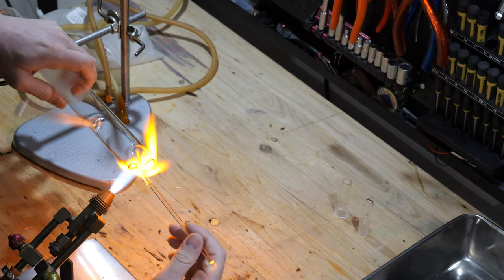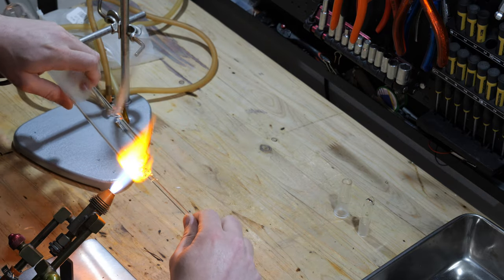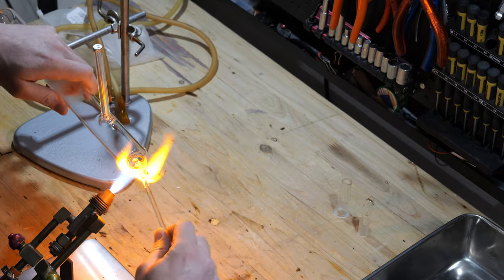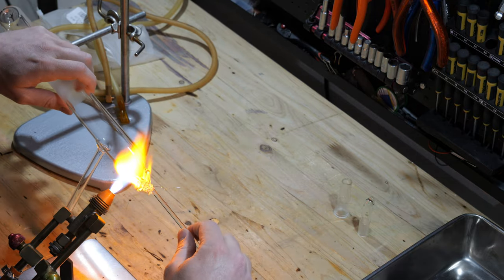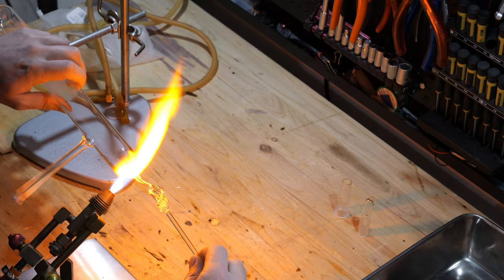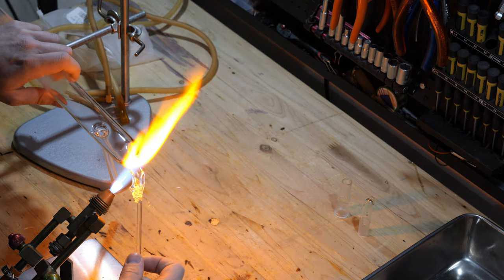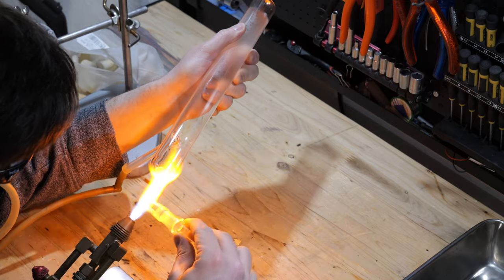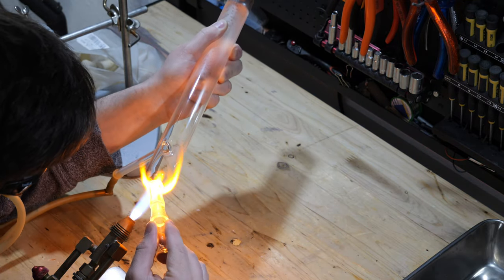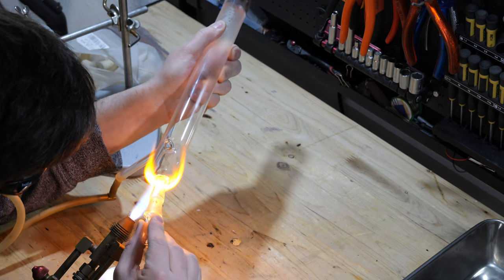Then, the other end was melted off, a hole blown, and an NS14 standard glass ground joint was melted on. An NS29 ground joint would have been better, but NS14 was the only size I had on hand. Certainly sufficient for a first test.